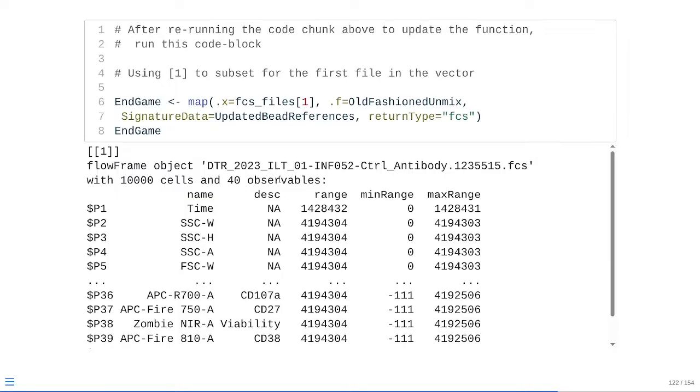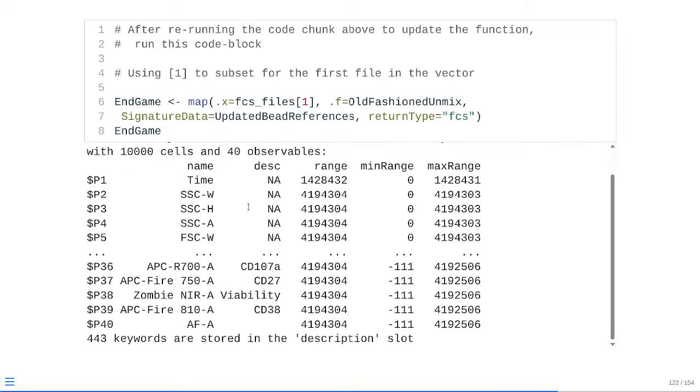As you may remember, we still have the same name of the original file. In this case, we have 10,000 cells, but instead of those 60, 70-something columns, we now have 40. If you look at the individual row names, we now go down to P40, and we can also see the fluorophores and their respective antigens are integrated in. And instead of those 700 keywords that were present for the raw spectral flow cytometry file, we're now down to 443 keywords total.